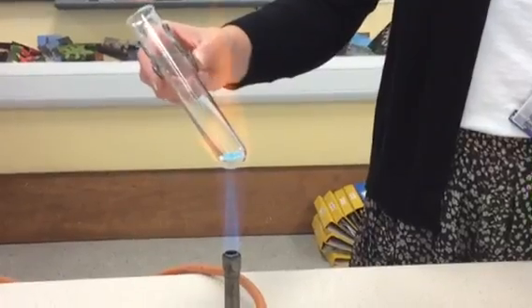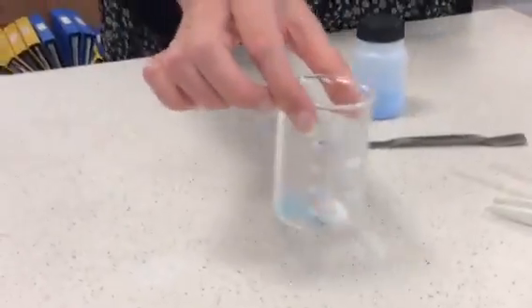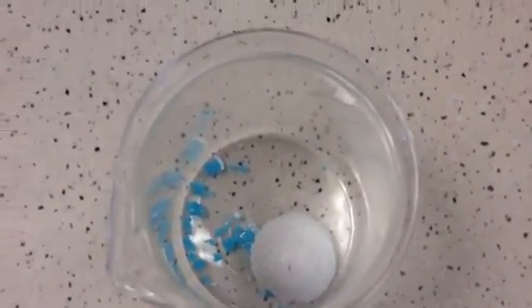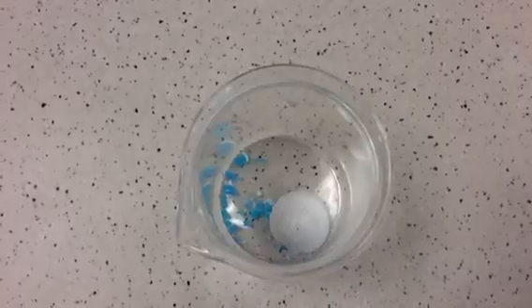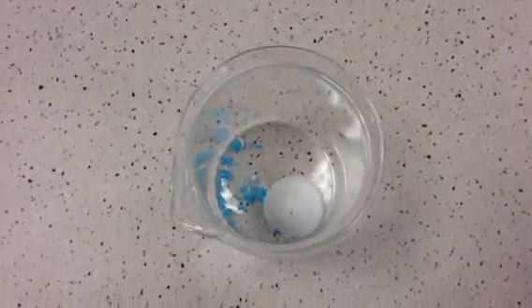Okay, so what we need to try and do is tip our boiling tube over. I just turn this to safety flame for a moment, and then inside the boiling tube you can see the copper sulfate that we've been heating. So think about what colour was it at the start before I was heating it in the Bunsen burner, and has it changed colour at all now? So I've been heating it for about a minute, I guess. Has it changed, or does it look the same?